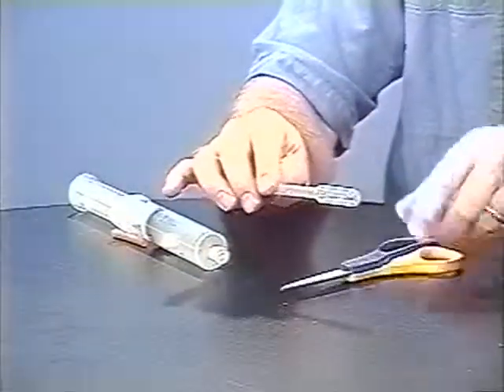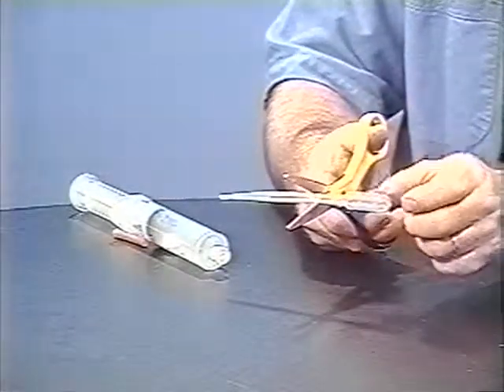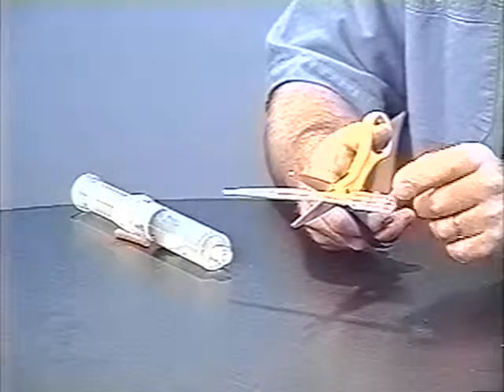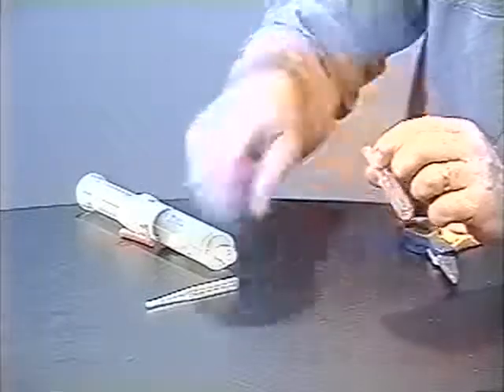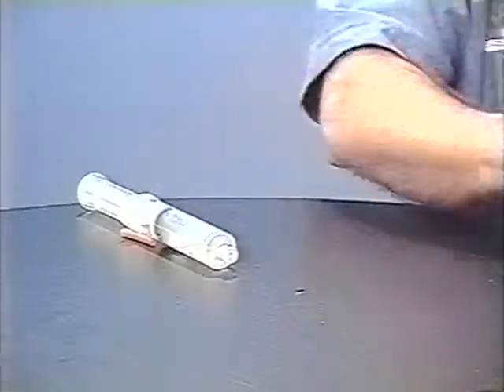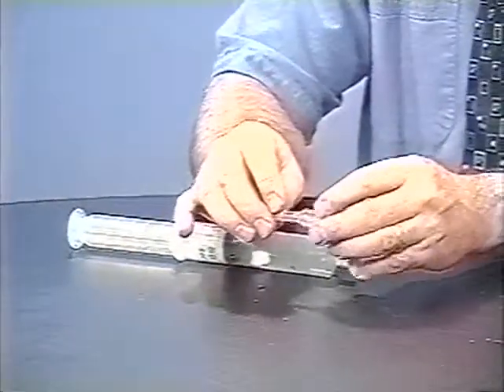This mixture is a lot of fun, and let's transfer it to a small rocket which we can launch. The next technique for transferring is to transfer to a rocket made out of a little pipette. To do that, first we need a rocket — we'll just take a big body pipette here with a thick stem and cut off part of it. Now we'd like to fill this rocket with the gas mixture, and then we'll ignite the rocket.